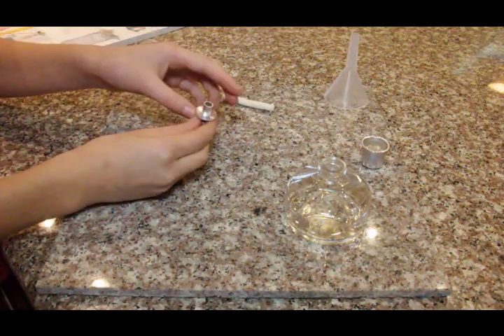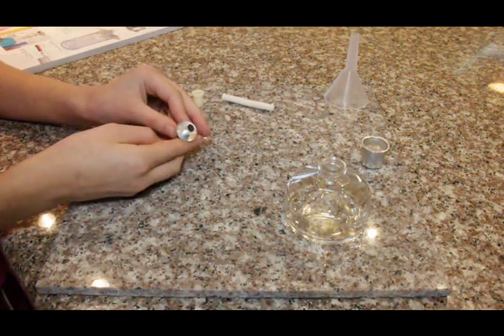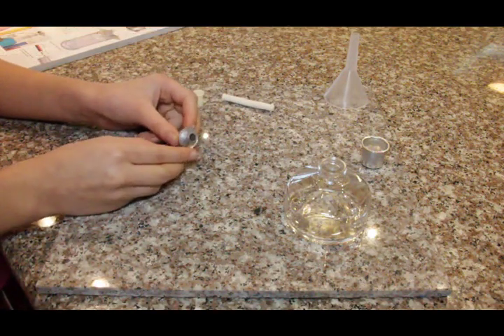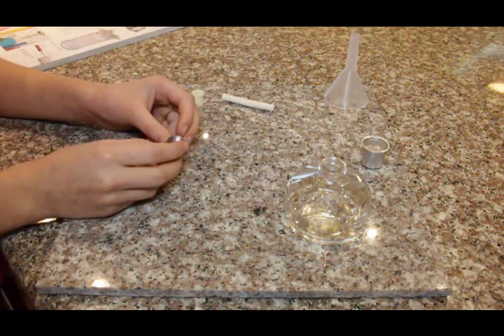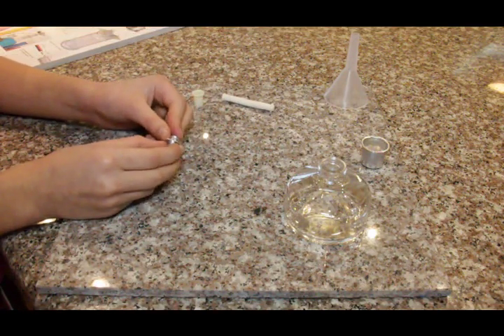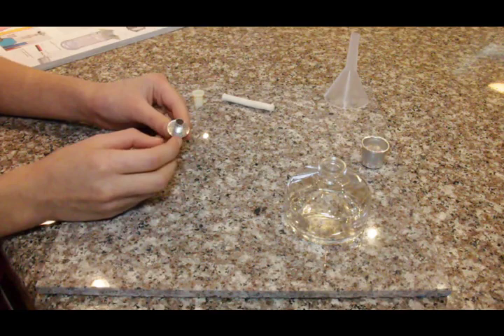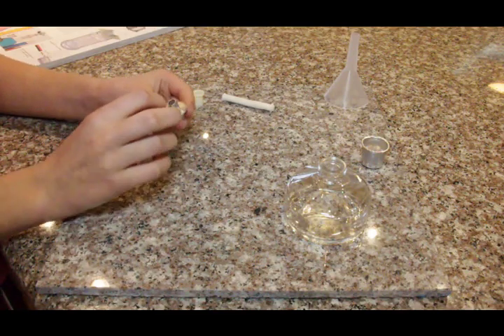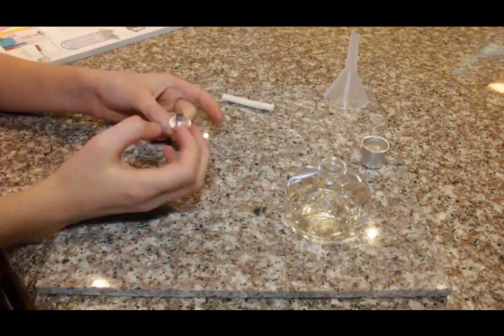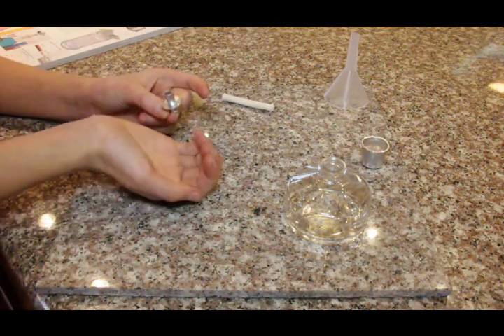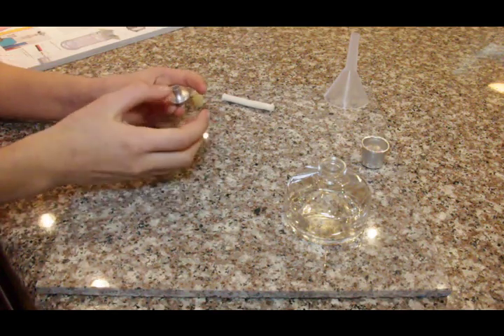So if you look at it, it will look like this. And if you were to put a drop of water in there, it would not flow out because it's curved down like a bowl.